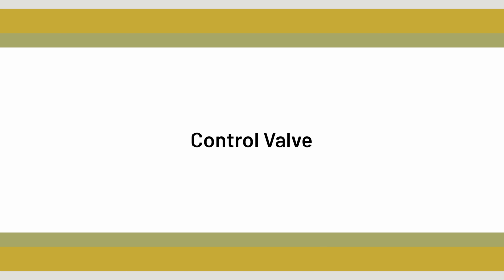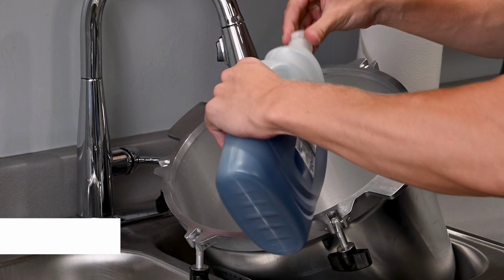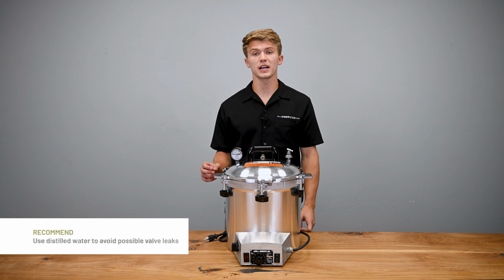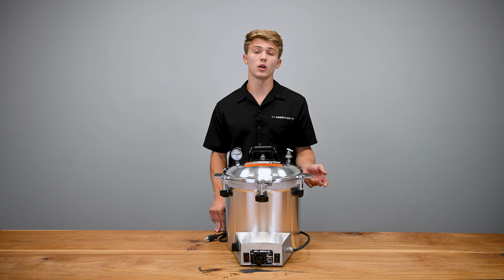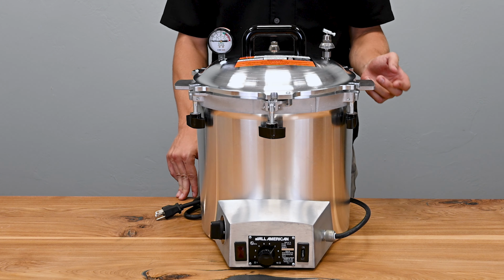Next, we will talk about the control valve. To ensure long life and proper operation, it is important to periodically clean the control valve thoroughly in hot, soapy water. If distilled water is not used, dissolved minerals could build up and cause the valve to leak. To clean any built-up materials, put the lever in open position and soak the valve in vinegar. Be sure to clean the control valve in hot soapy water after soaking in vinegar. In the event that you are unable to properly remove any foreign materials in your control valve, we recommend that you replace the control valve with a new one.